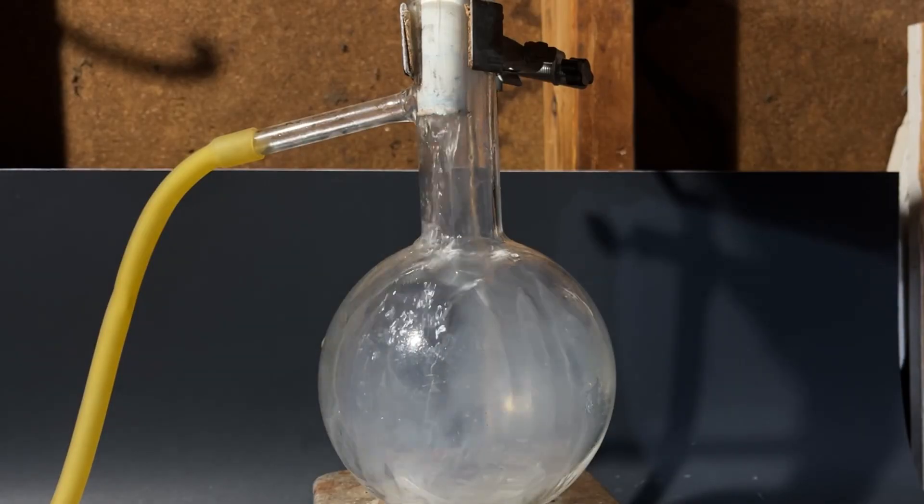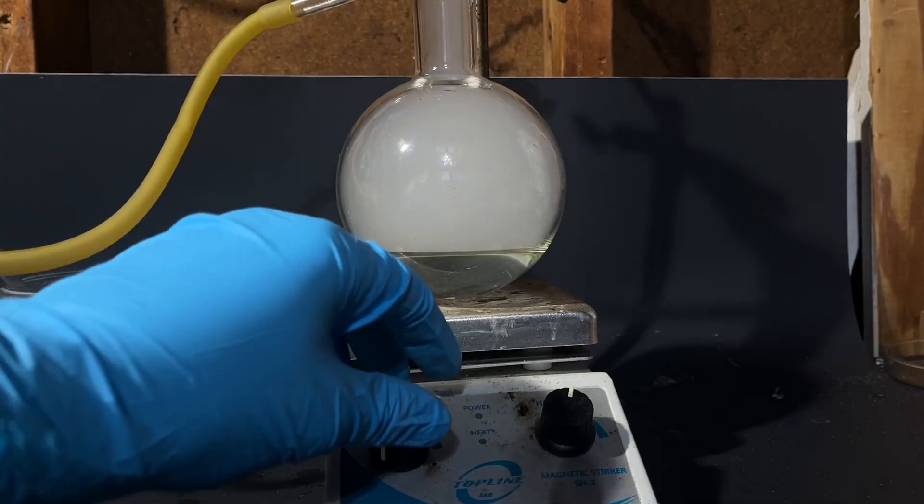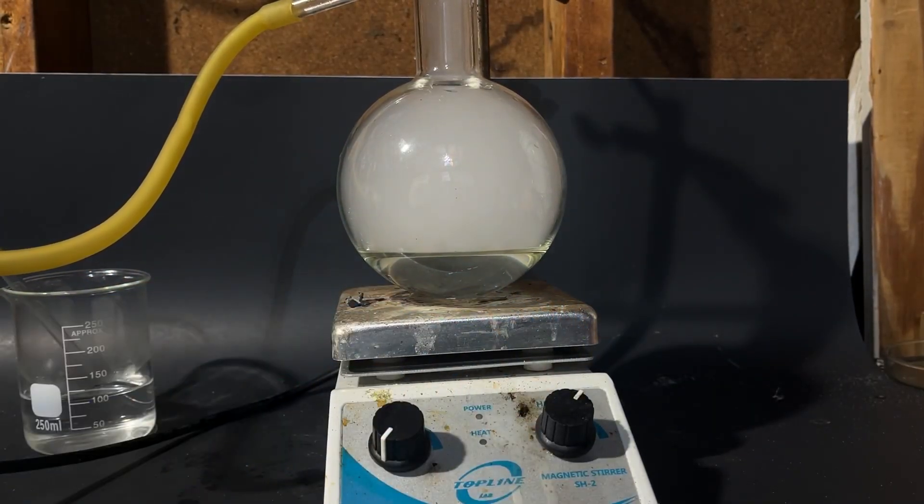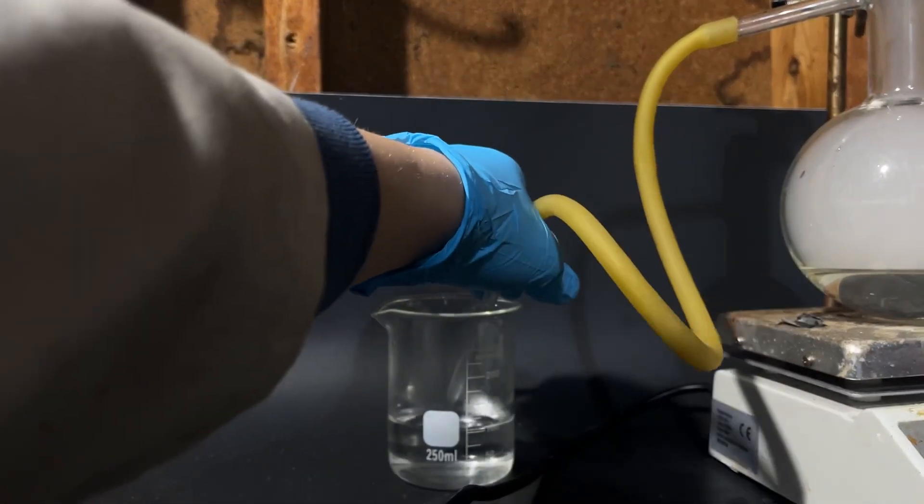Plan 2. For my second attempt, I add an arbitrary amount of hydrochloric acid to a round bottom flask, turn on my hot plate to boil off hydrogen chloride gas from the hydrochloric acid, and bubble the gas into 100 milliliters of ammonium hydroxide solution.